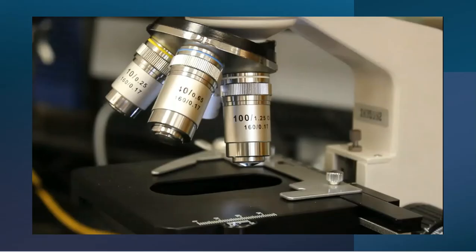I do think that the 4 is the easiest to view in the very beginning, and as we go closer and closer, sometimes it's a little more difficult to get things in focus. But once more, this is just me using my method when I get onto the microscope.